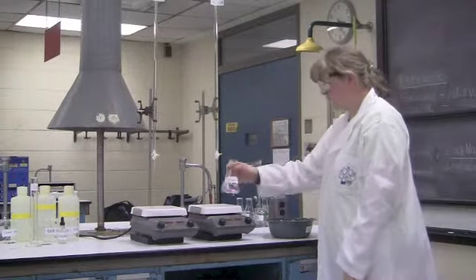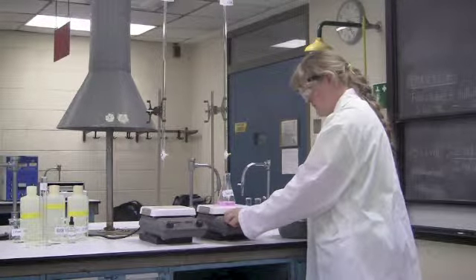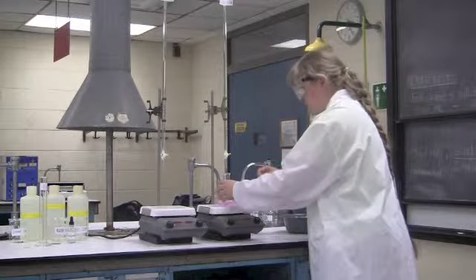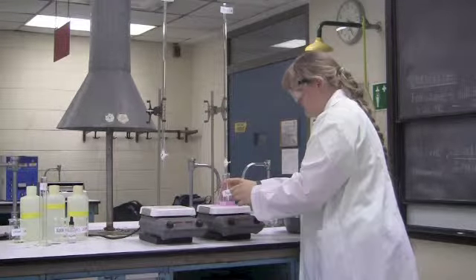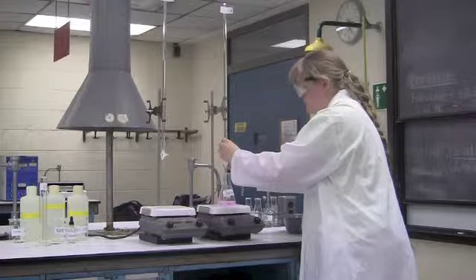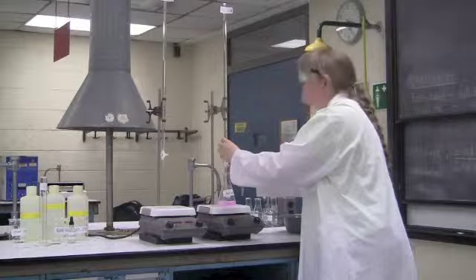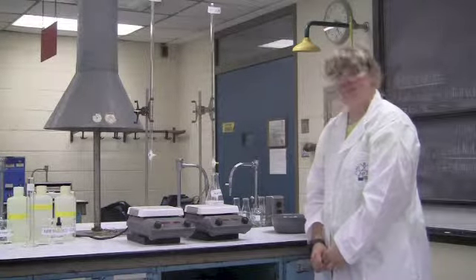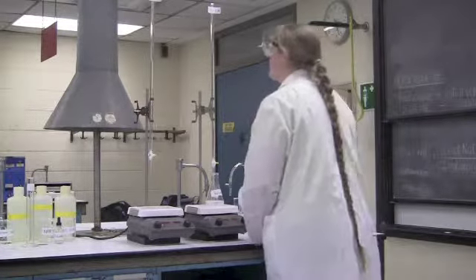We're going to remove the analyte from the ice bath, and we're going to titrate the analyte with the HCl 0.1 molar. First, Jill turned on the stir bar to ensure that the analyte is mixed well. She will now add 0.1 molar HCl until the solution turns from a light pink to a cloudy white. The solution has now changed to a cloudy white, and the initial volume of the reading is 0.00 ml.